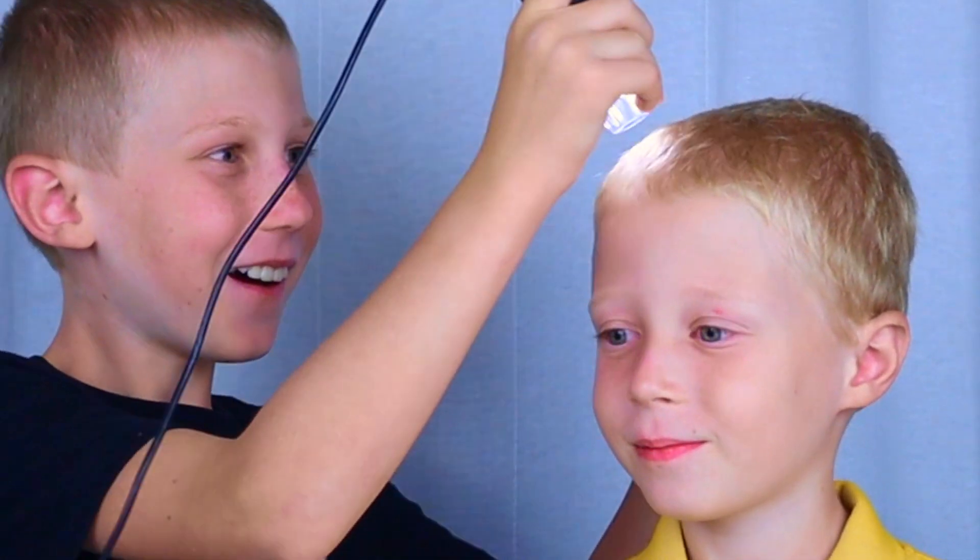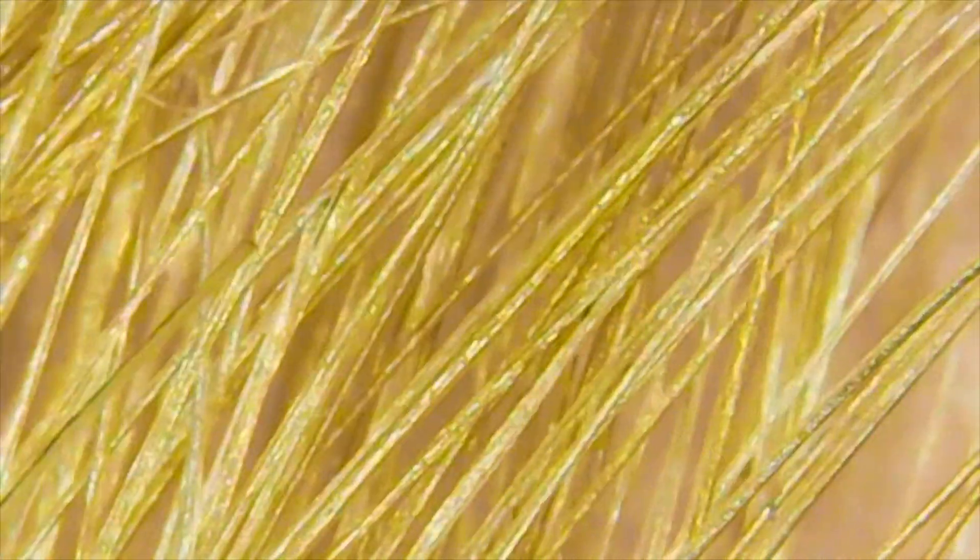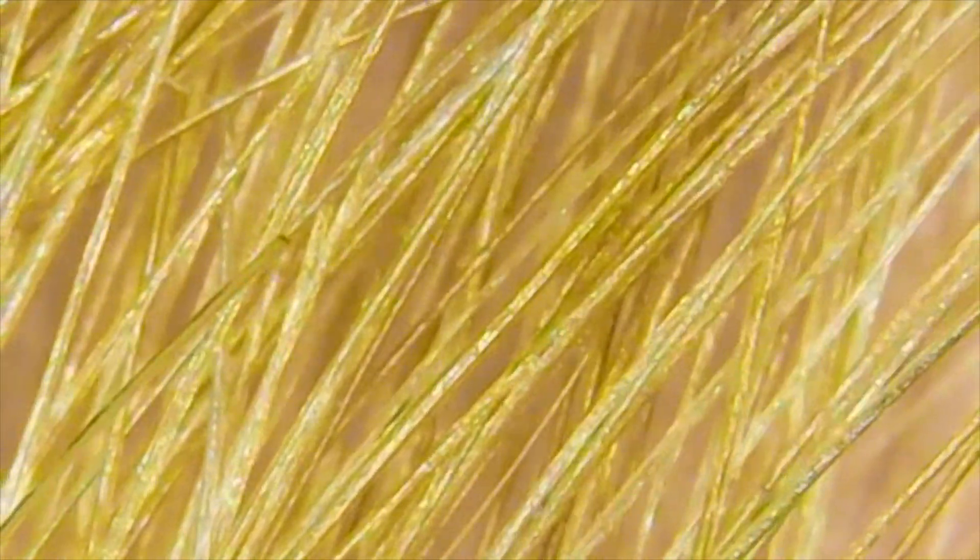That gives me an idea. Let's see your hair. Wow! It looks like spaghetti too.